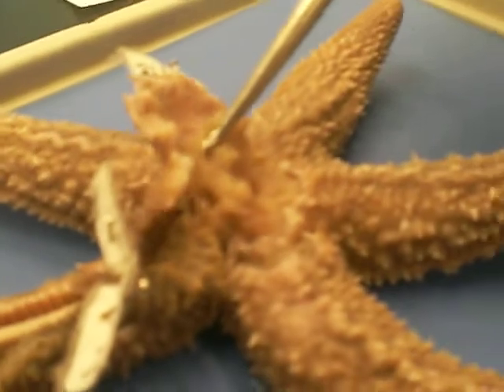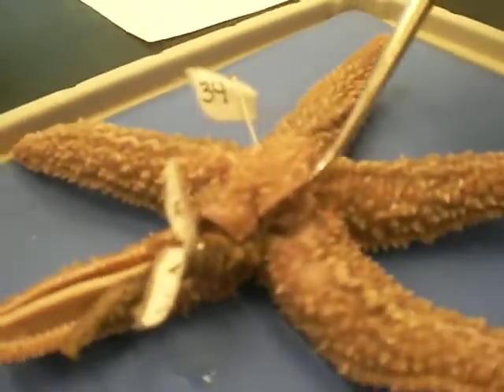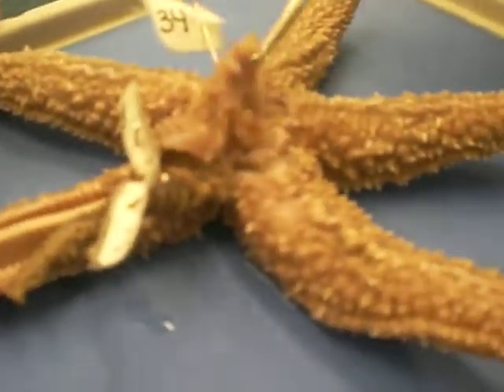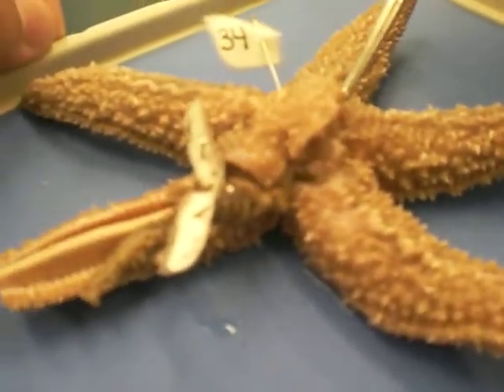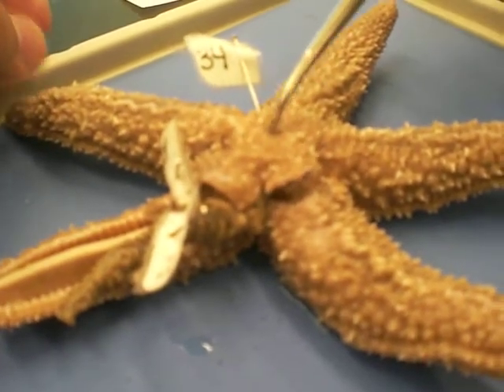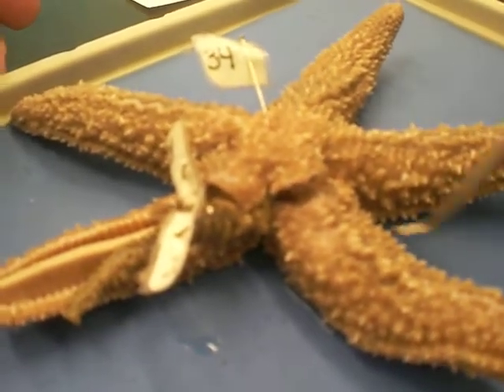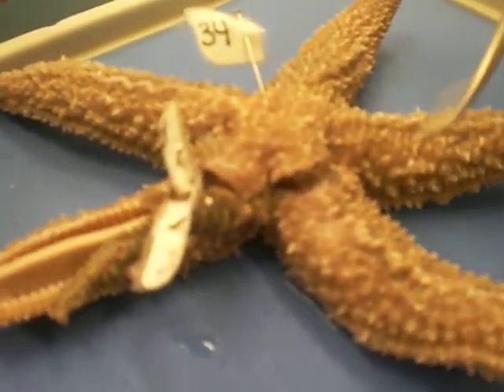The cardiac stomach comes out when the starfish is feeding. This is the aboral surface. And this is the oral.